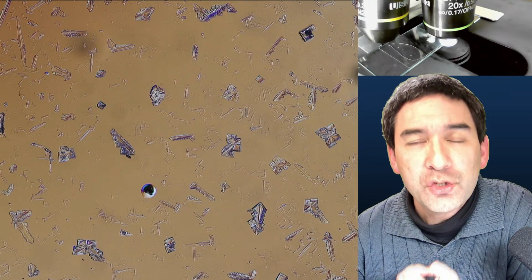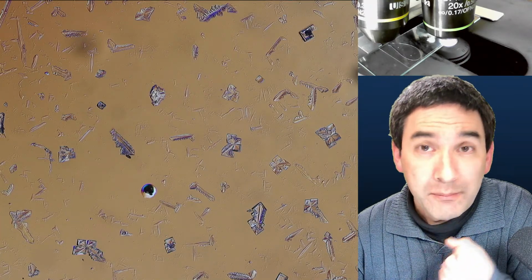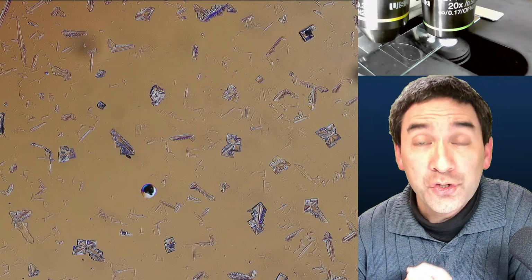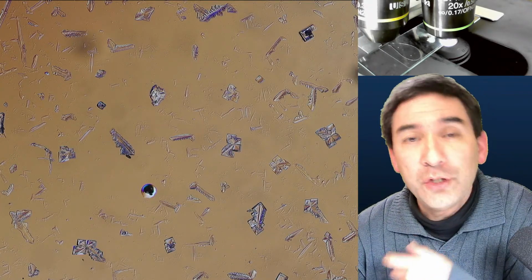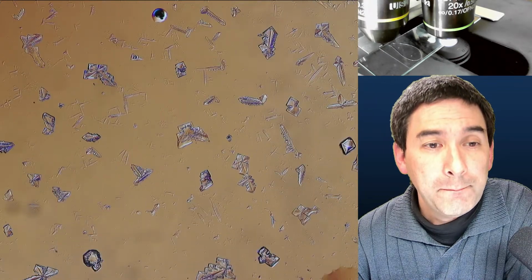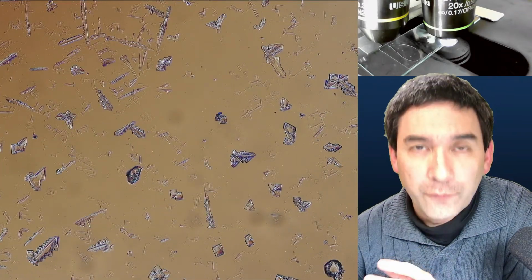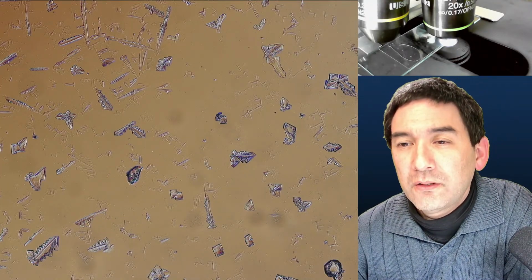So the substance for crystallization was only present for a very brief moment as the match head was actually burning. This is when the substance was present and in sufficiently high concentration, and then it went from gas directly into solid. And now crystallization cannot continue because there is no more substance around to crystallize. So this is a fairly instantaneous event, but it is still a gradual process during the crystallization. Because the crystals were smaller at the beginning and then they had to form, but this was very, very quick.